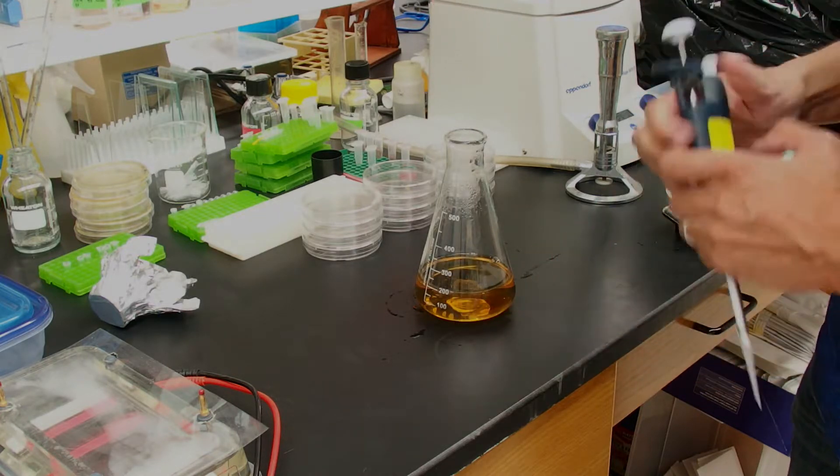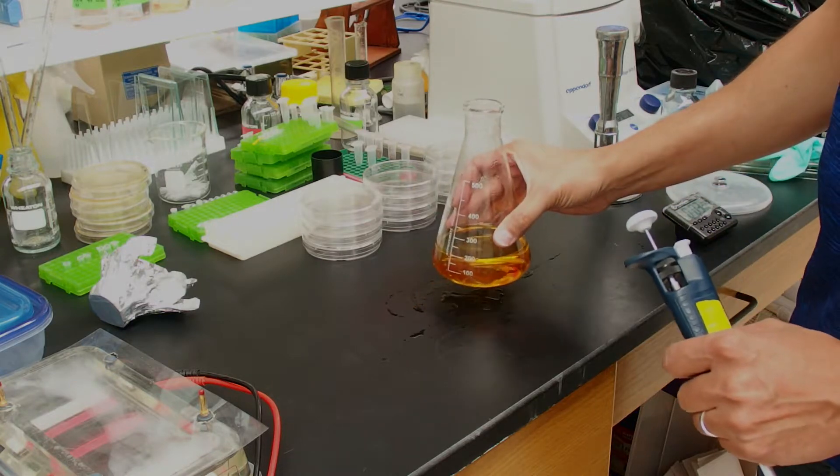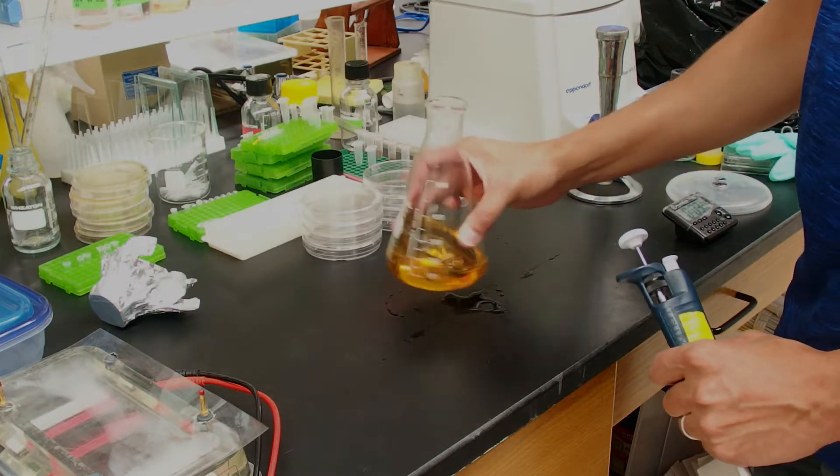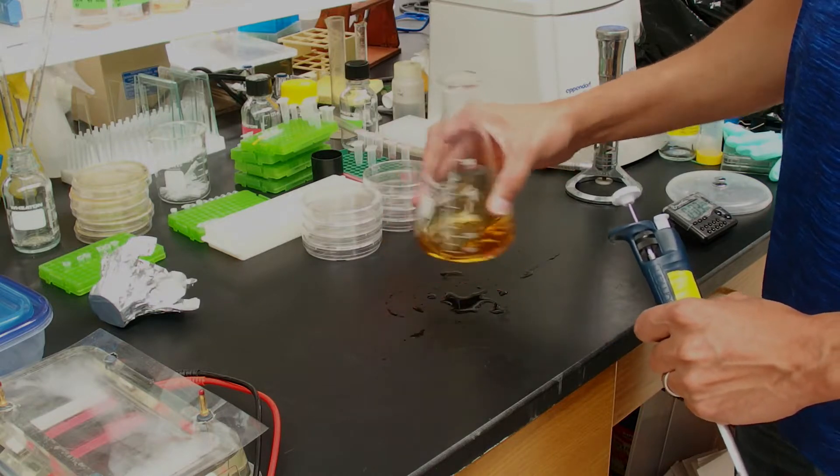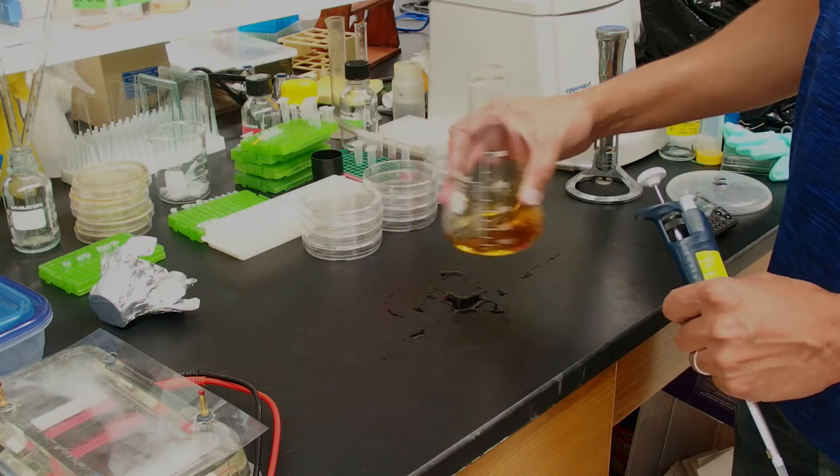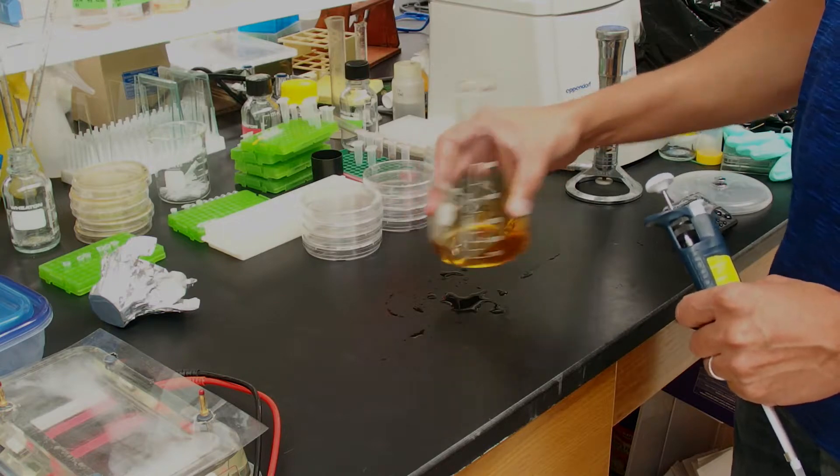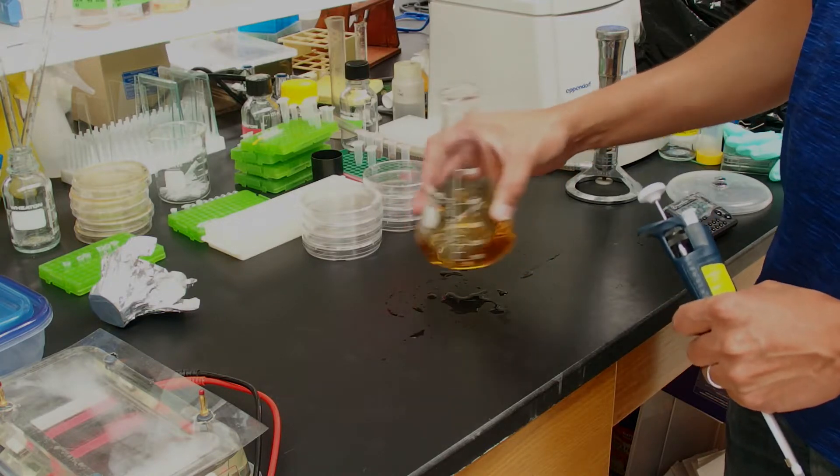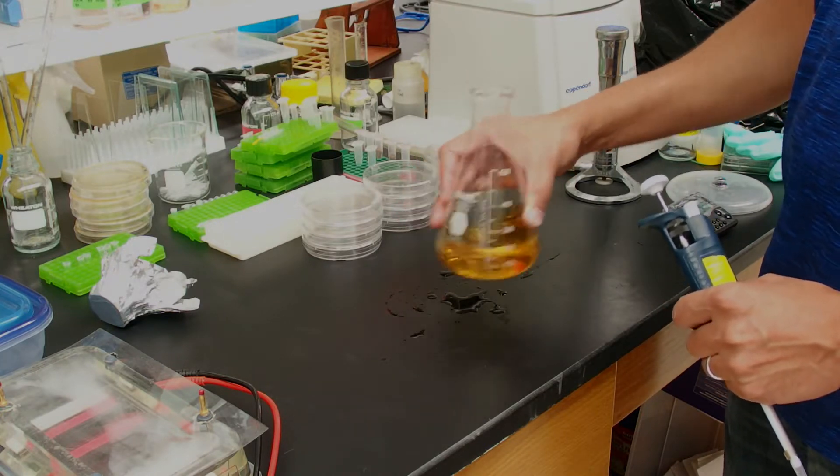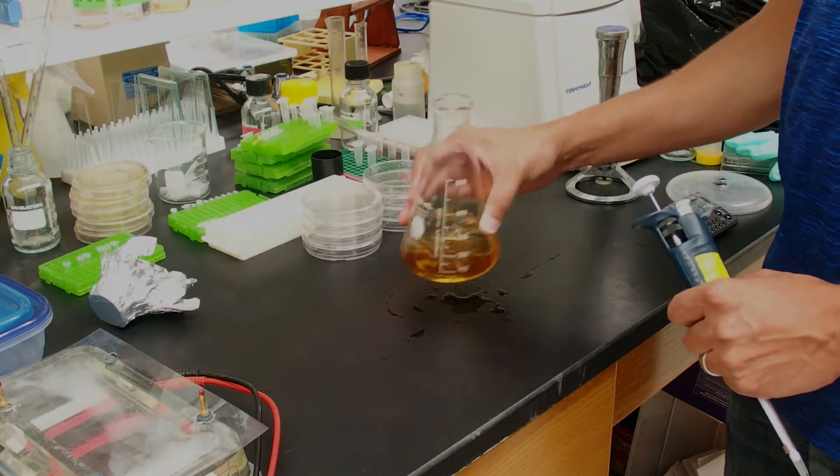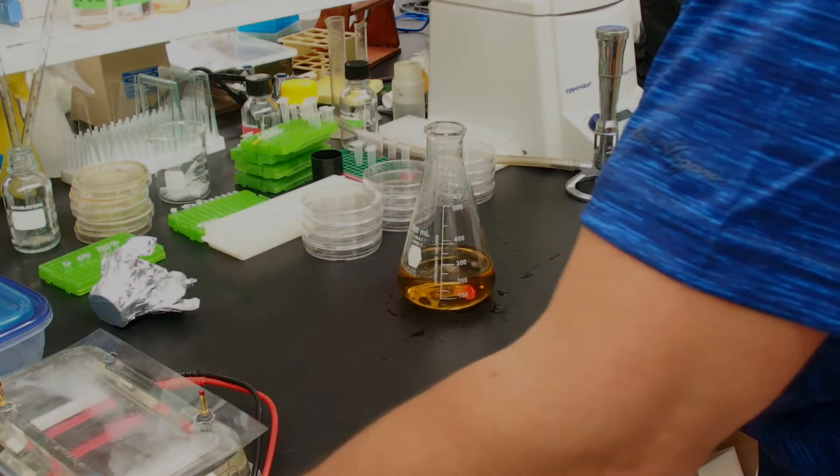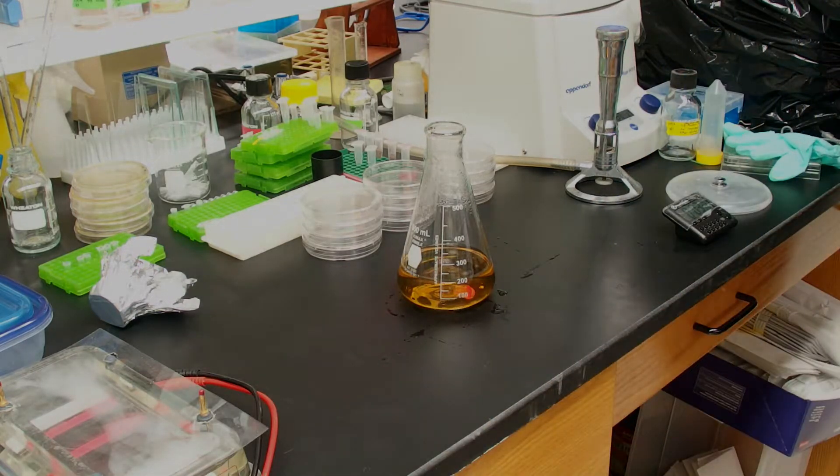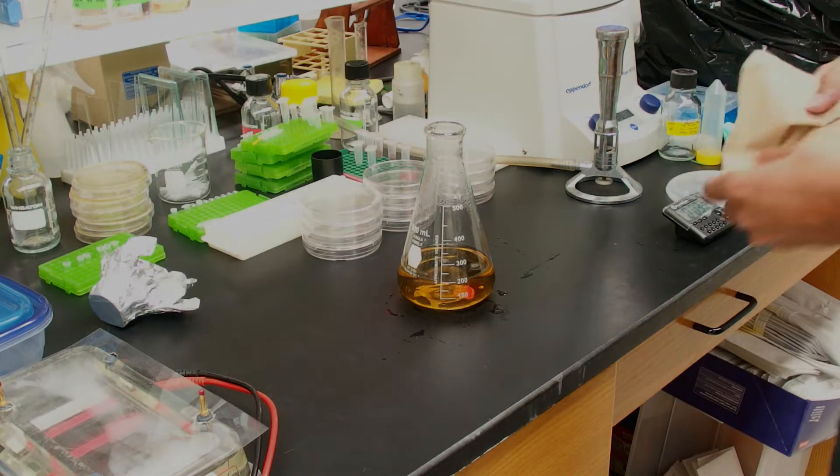We're also trying very hard not to make too many bubbles here in this LB agar. I've added the antibiotics. I'm going to swirl gently. If we make a lot of bubbles, we're going to have some bubbles in our plates. And I do have a way of popping those bubbles that I can show you. That things will be smoother. That's fairly well mixed.